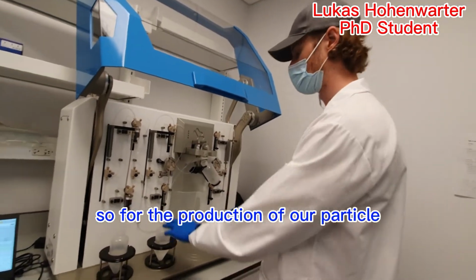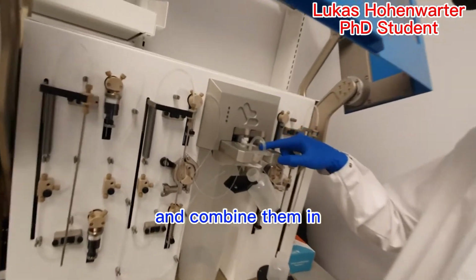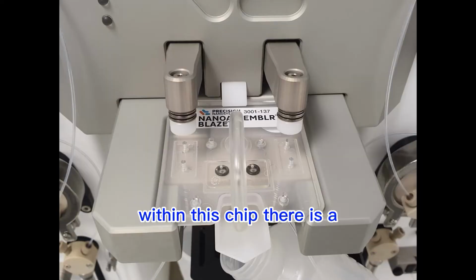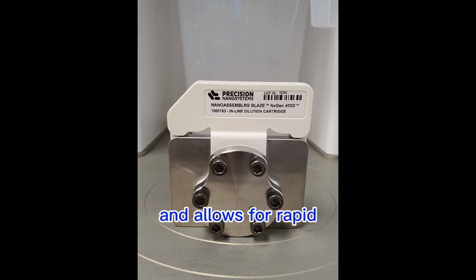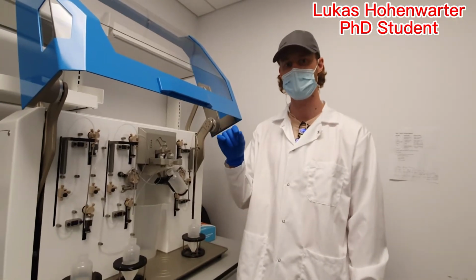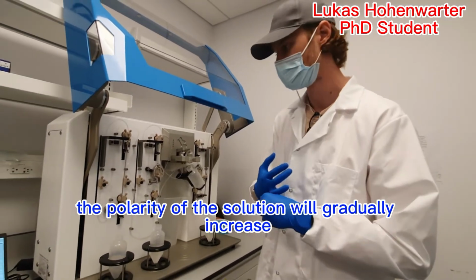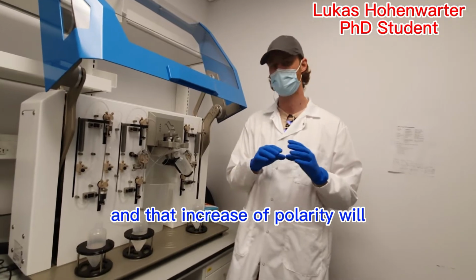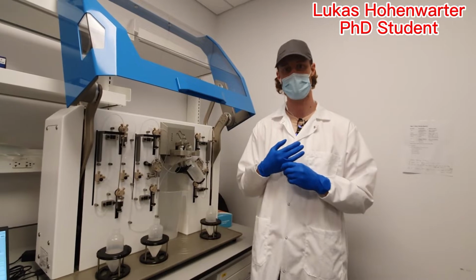For the production of our particle, the Blaze will draw both of the liquid streams and combine them in the microfluidic chip that sits in the center of the machine. Within this chip, there is a microscale flow path that has a certain geometry and allows for rapid, precisely controlled mixing of the two phases. As the liquids pass through this flow path, the polarity of the solution will gradually increase, and that increase of polarity will drive the assembly of lipids into the final nanoparticles.